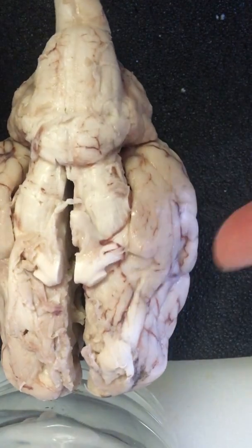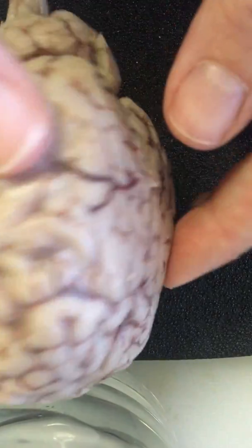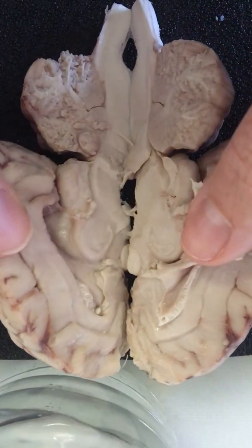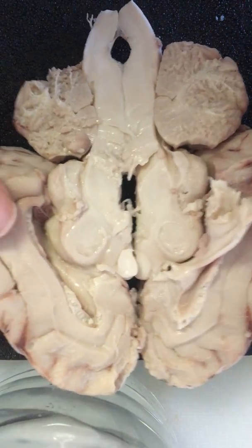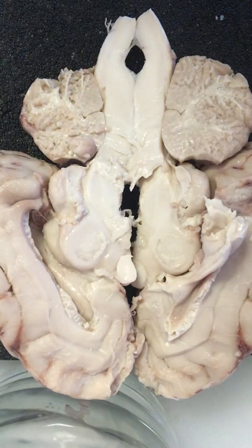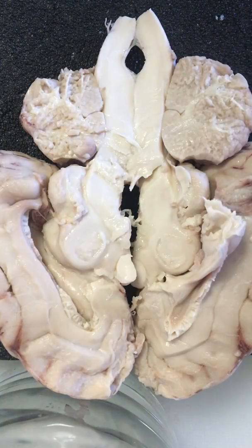And then you can see down here, over here the temporal, and then the parietal lobe again. All right, let's flip this sucker over. We're going to get inside here so we can see inside of the brain. It's really neat to read about all the parts of the brain, and then actually seeing it definitely allows you to absorb a lot more information, which I'm sure is the whole point of this, but it does help to have hands on. So we're going to open up our brain here.